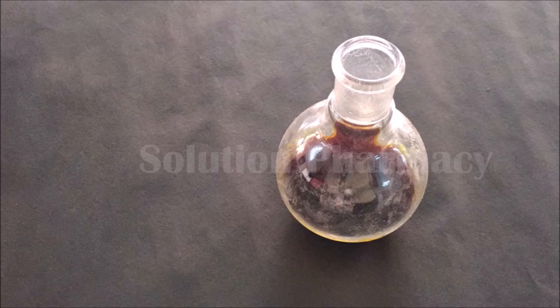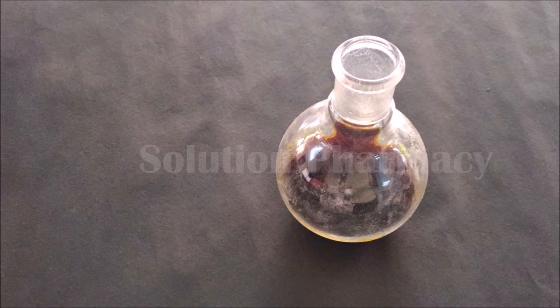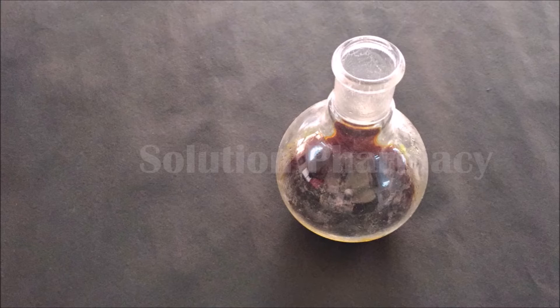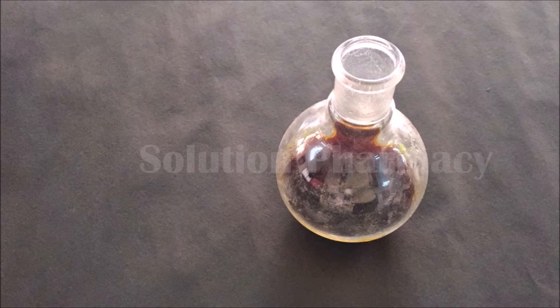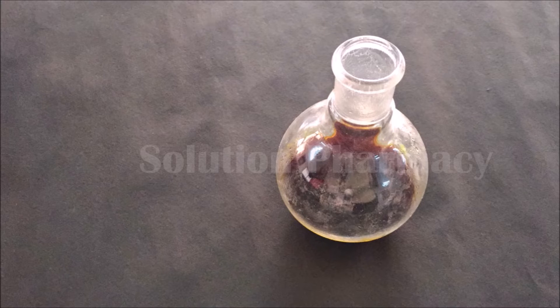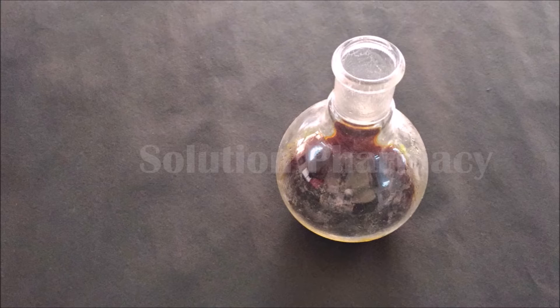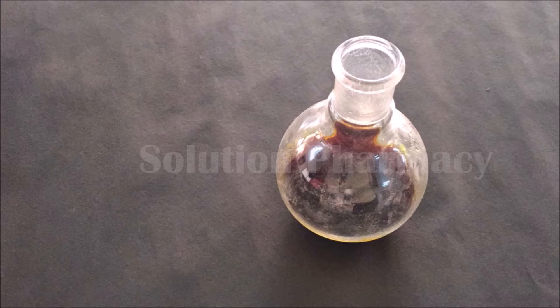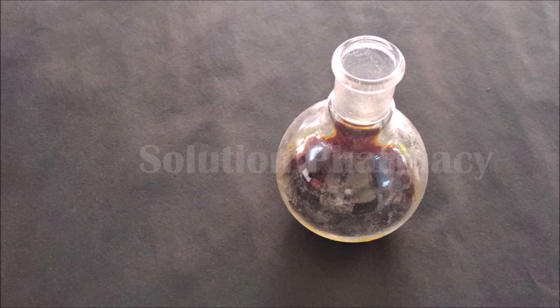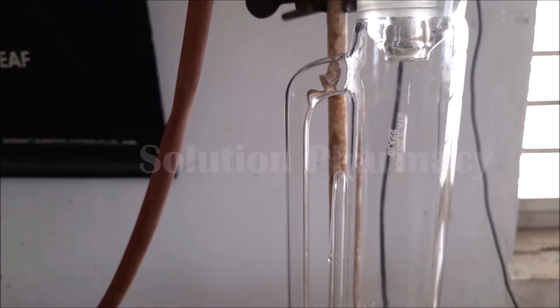Next, we have to concentrate this liquid extract by evaporating the solvent. If we directly evaporate the solvent on a heating mantle, water bath, or hot plate in an open vessel, there will be loss of solvent into the air. If we want to prevent this solvent loss — that is, if we want to recover the solvent vaporizing during concentration of the extract — it is possible by using the same Soxhlet assembly.